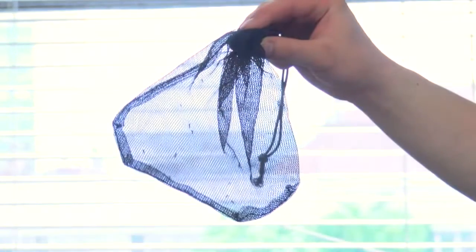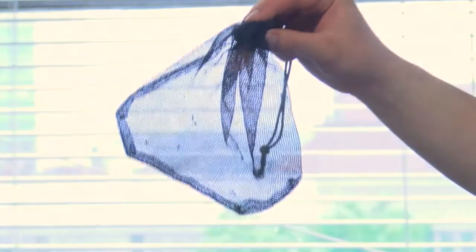Most available traps rely on either battery or mains power to power the fan. Batteries will last for one to two days at most before they need replacing, requiring collectors to visit each trap frequently with fresh batteries. During these visits, the trapped mosquitoes will also need to be collected, as if they are left inside the trap for more than a couple of days, they will quickly dry out and make it very difficult to identify them. If you are using a source of carbon dioxide as part of the attraction of the trap, you will need to either carry large gas canisters around with you, or regularly replace a source of carbon dioxide such as dry ice. Finally, it is important to consider the weather on your trapping days, as strong winds and heavy rain will stop mosquitoes from flying and can even damage the traps. It's always a good idea to record these meteorological variables so that you can better explain variation in your trap collections.